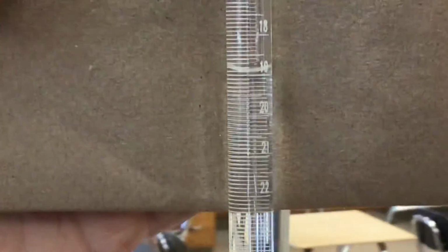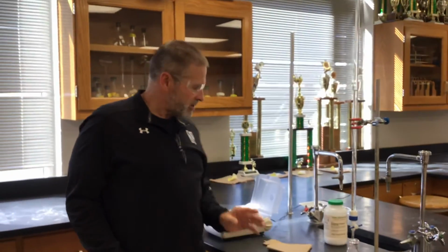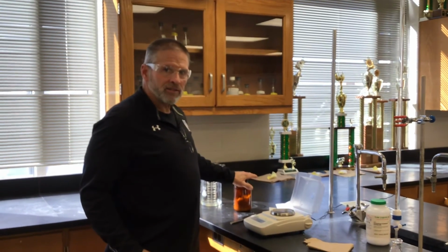I'll move over just a little bit so we can line it up with the graduations. All right, Mr. Hevel. Okay, so remember the goal. We're trying to calculate the molar mass of this unknown acid. Do we need to identify what the acid is? We don't care who it is. It's impossible for you to figure out who it is. That is not part of the deal. It's just what is its molar mass.